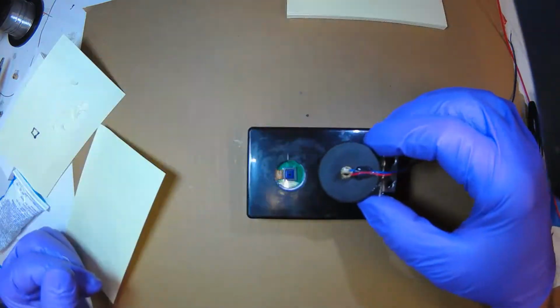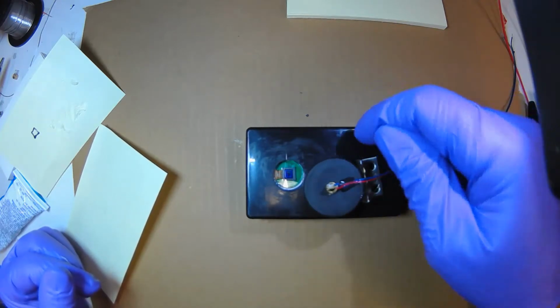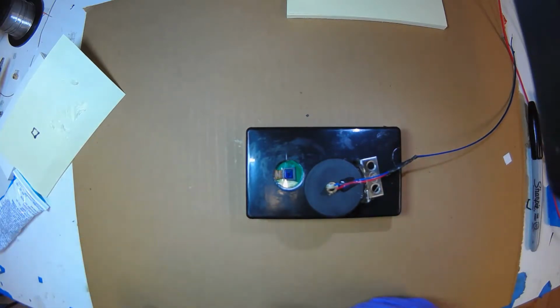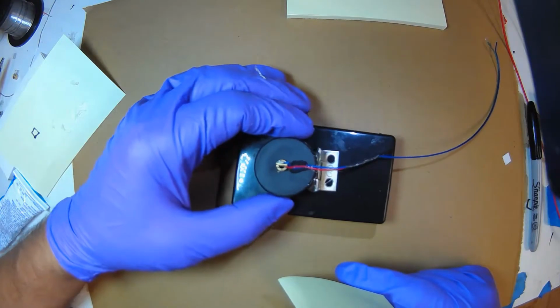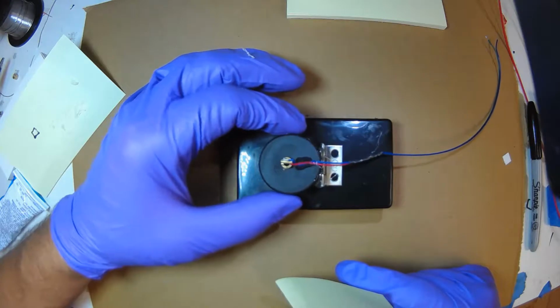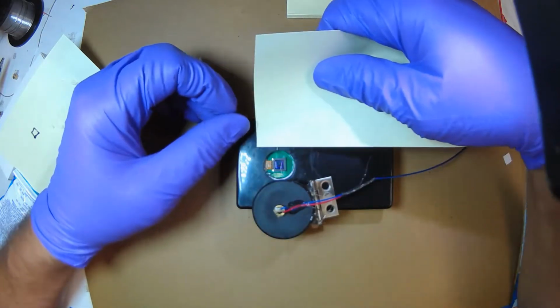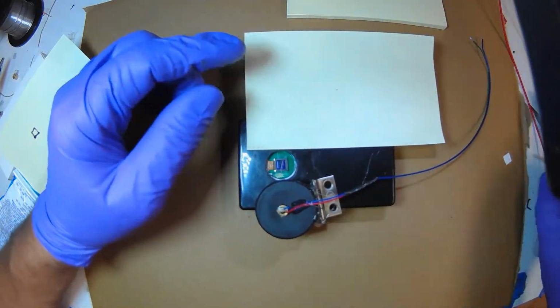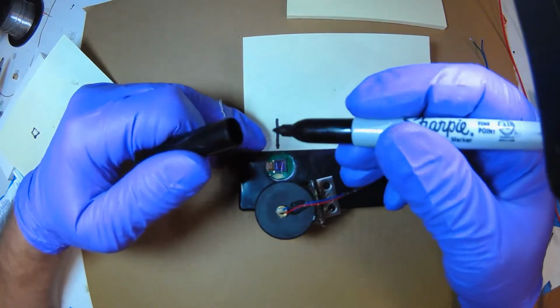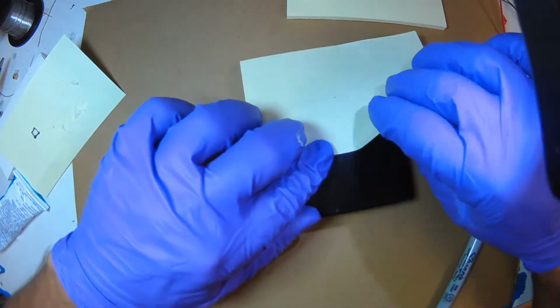We can make a hole so we can put the wires into the box where the Raspberry Pi is, to get power for the LED. To do that, we can just coarsely locate the laser. Later on, once we fire it up, we'll move this to get the perfect alignment. But for the wire, we can just estimate it. What I'm going to do is put this down here and mark where the center of the image chip is. And I'm going to do the same for the other side.